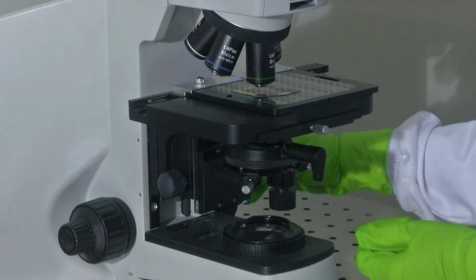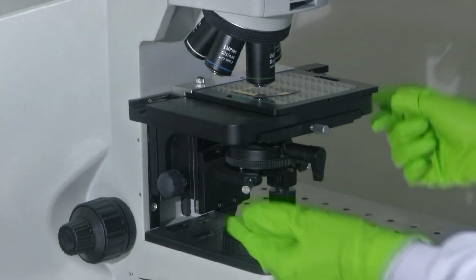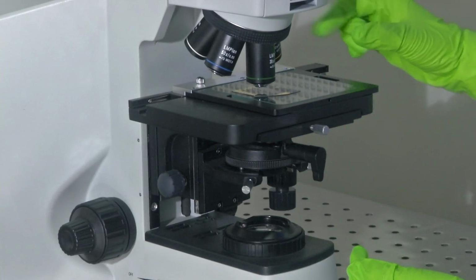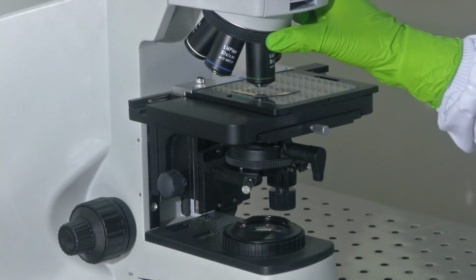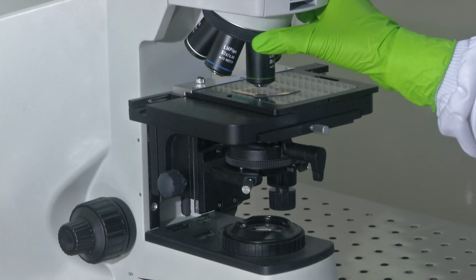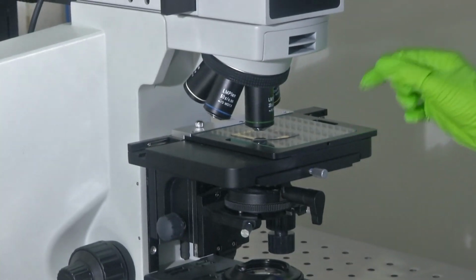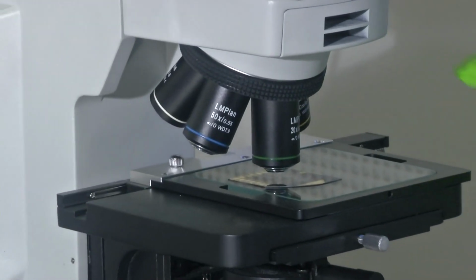So, there is another knob on this side which could help you move the stage in the z direction. Now that we have this stage, you could place your sample on this. And what is this? This is the rotating nose piece, or the turret. Here this is more sophisticated, unlike the stereo microscope which just had a knob, because the magnification power when it comes to a stereo microscope is not too high.